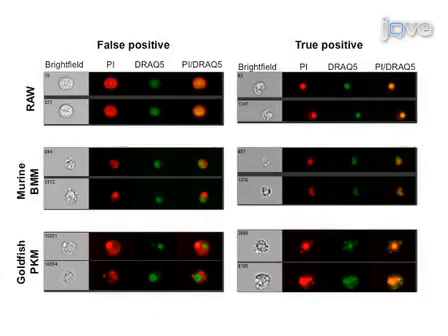Representative ImageStream flow cytometer images show the extent of false positive staining in 3 unique cell populations: 1 commonly used cell line, RAW macrophages, and 2 primary cell lines, murine bone marrow macrophages and goldfish primary kidney macrophages. The use of goldfish primary macrophages highlights the applicability of this technique across a variety of cellular platforms. True positive events display the expected co-localization within the nuclear compartment between PI and DRAQ5, a highly membrane-permeable dye that accurately stains the nuclear compartment of living and dead cells, as evidenced by the yellow staining.